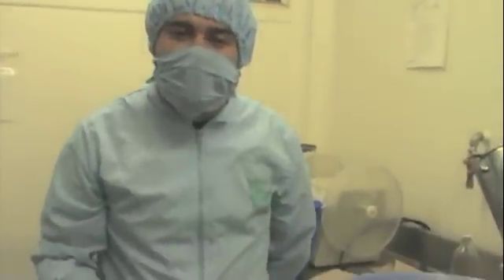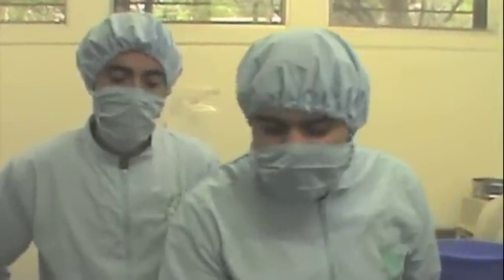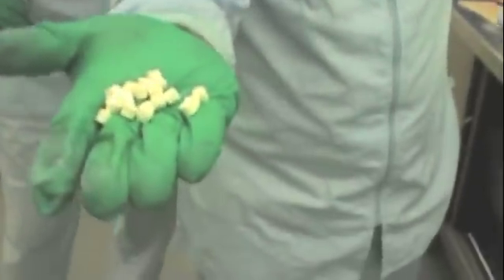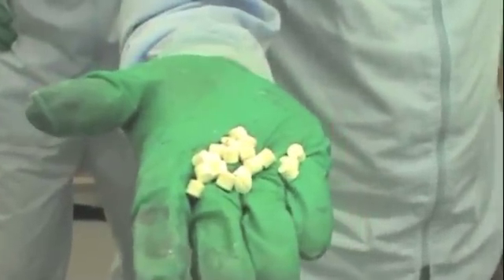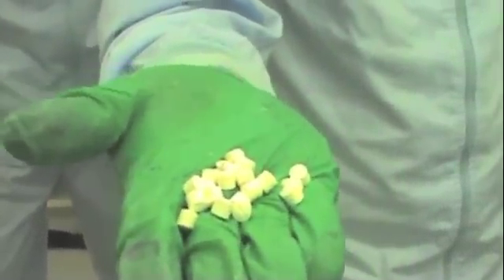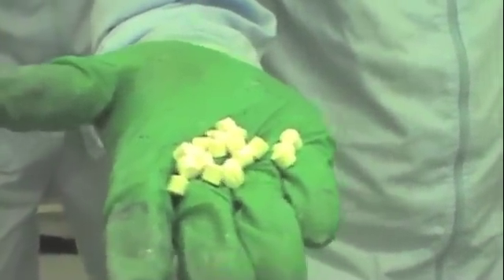After the whole process of dry granulation, of making our final product flow more freely with the help of the granulated form and the lubricant, this is our final result. They are little but thick tablets, very smooth and, I must say, very beautiful. Yes, they are. Congratulations. Thank you. And this was dry granulation.